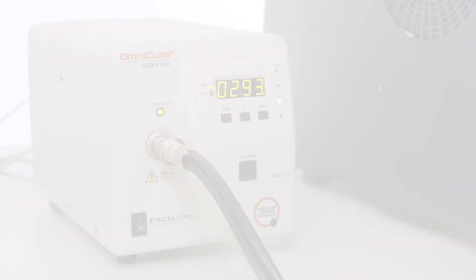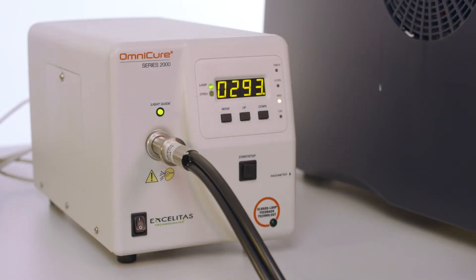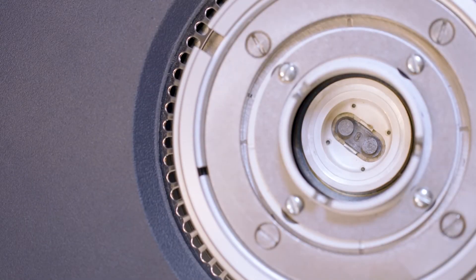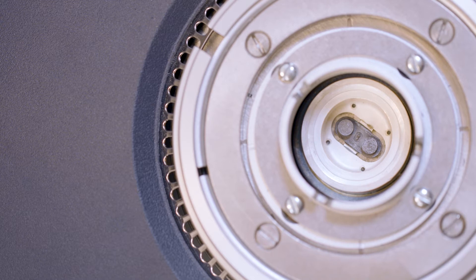Once the PCA is installed and the UV lamp is warmed up, light intensity adjustment and balancing is needed to make sure the sample and reference are under the same level of light irradiation.